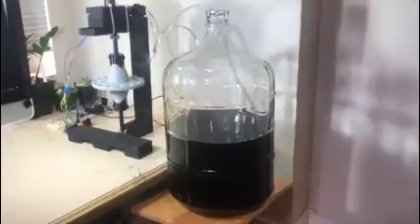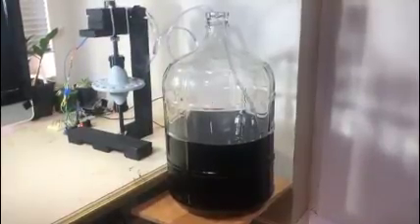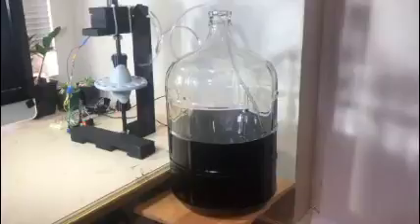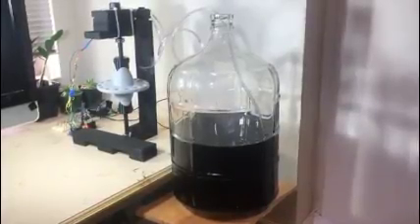Here, we see the fluid being extracted by the device and the rotor turning to the next sample. All of this is timed at specific intervals so a sample can be taken every hour. The data is then pushed to a server where it can be analyzed and incorporated in our dataset.